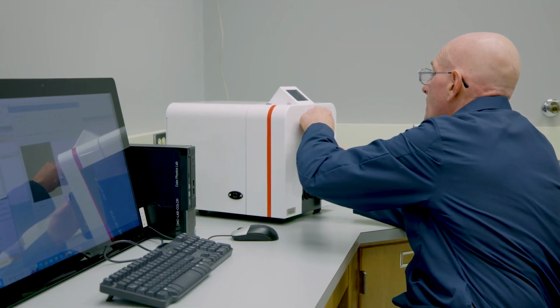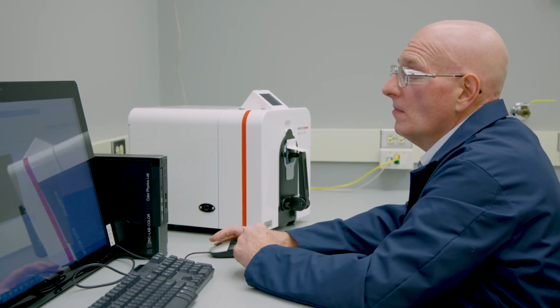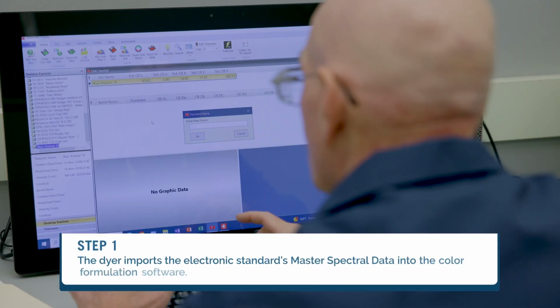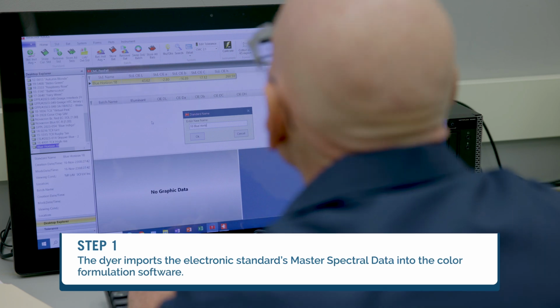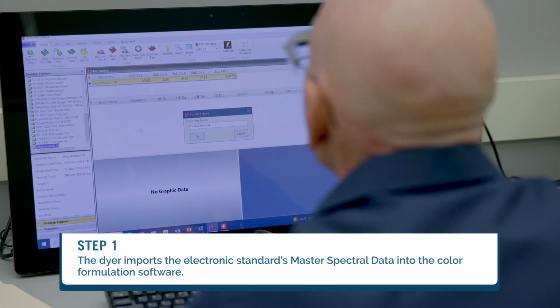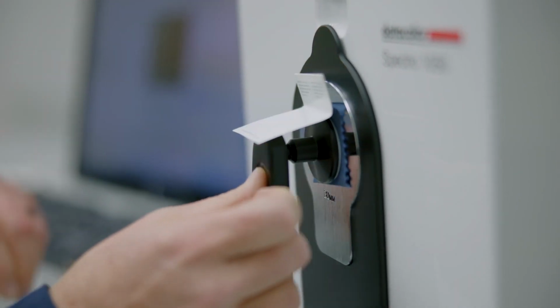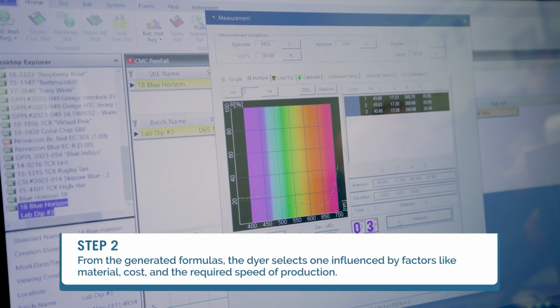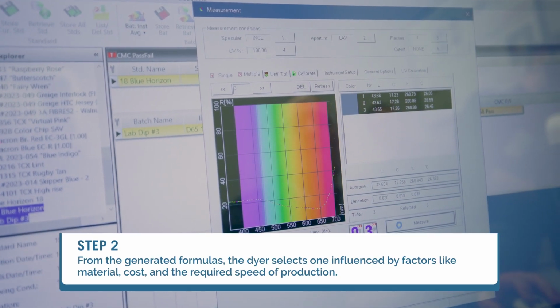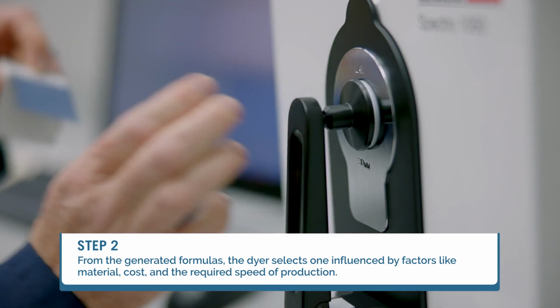and substrate. In best practices, the electronic and physical color standard is supplied by a third-party color standards provider. The dyer imports the electronic standard's Master Spectral Data into the color formulation software. When a third-party standard is not provided, the physical standard is measured with a spectrophotometer. From the generated formulas, the dyer selects one influenced by factors like material, cost, and the required speed of production.